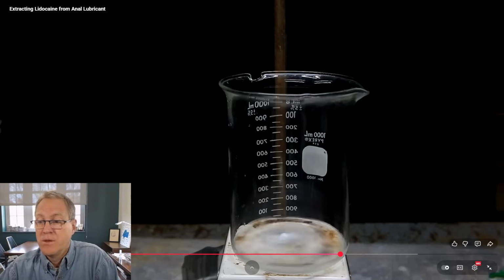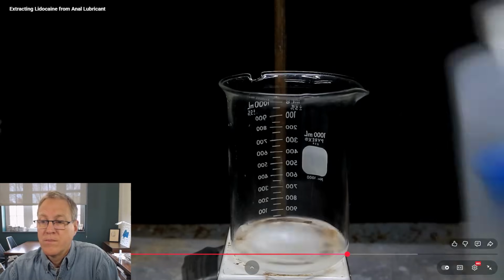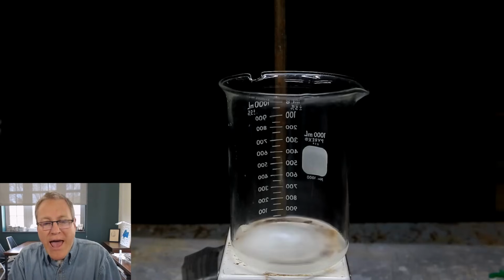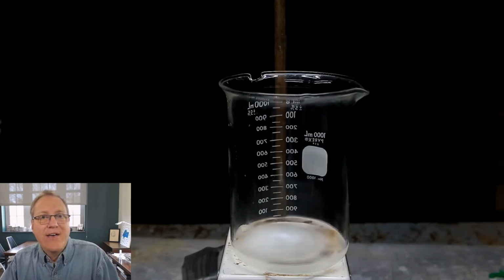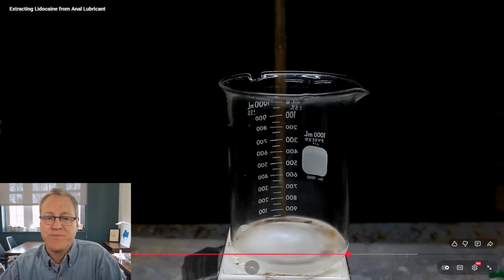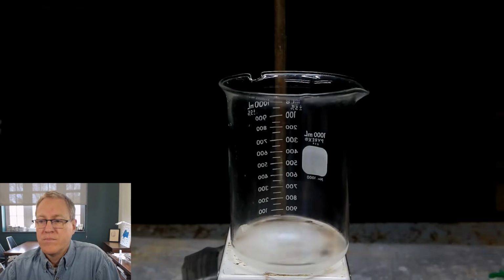The more water that we add, the less and less soluble the lidocaine will be in the solution. In theory, if we do this really slowly, we can probably grow some pretty nice crystals. However, this is almost like a titration where you're adding the acid or whatever to change the pH. So he's adding water to change the solubility, and eventually he's going to have enough water that his product is insoluble. So it's very much like a titration. However, I wanted to go quickly, and actually surprisingly, even when you go quickly, you still get crystals.